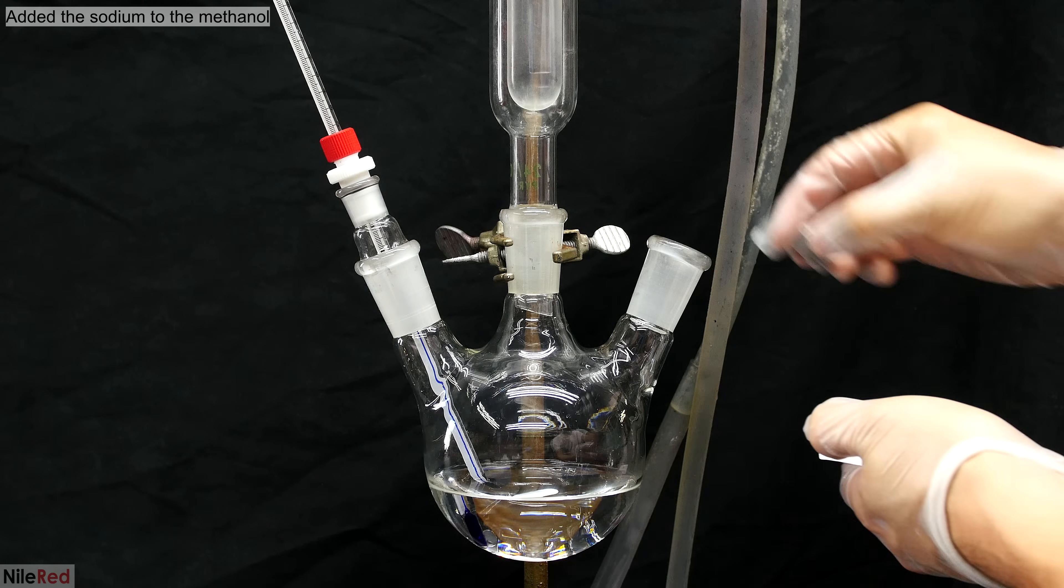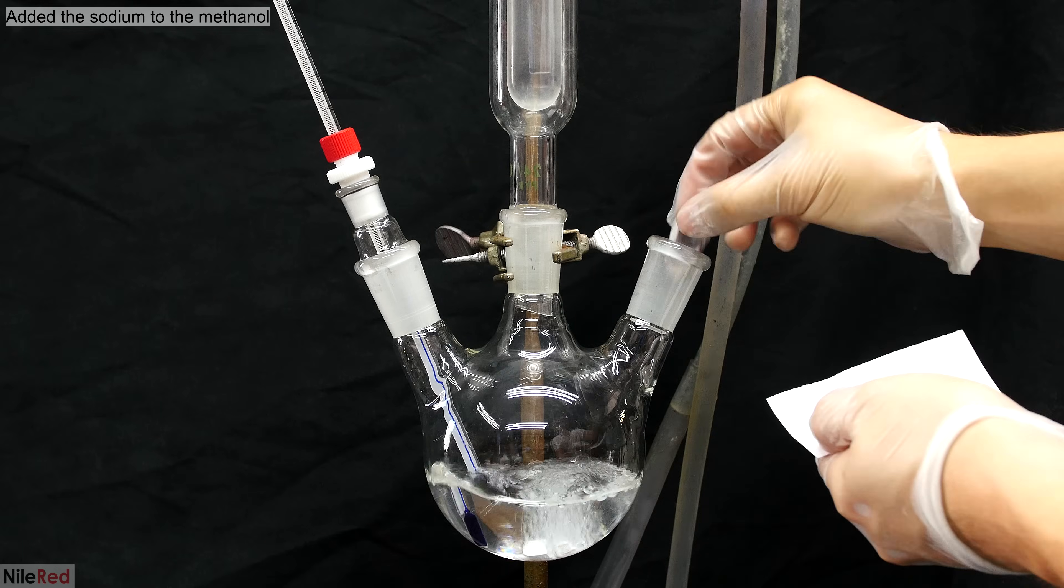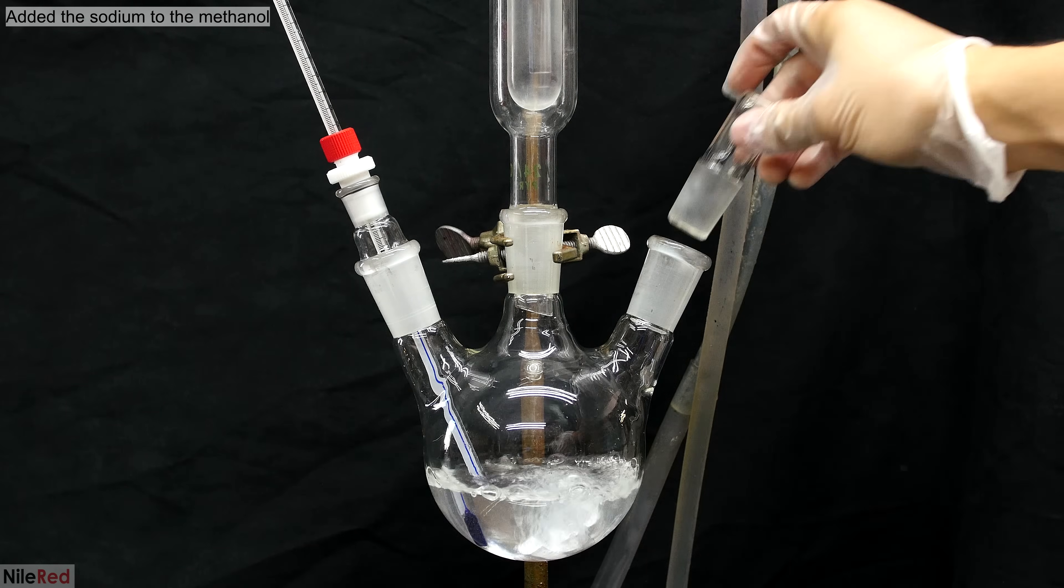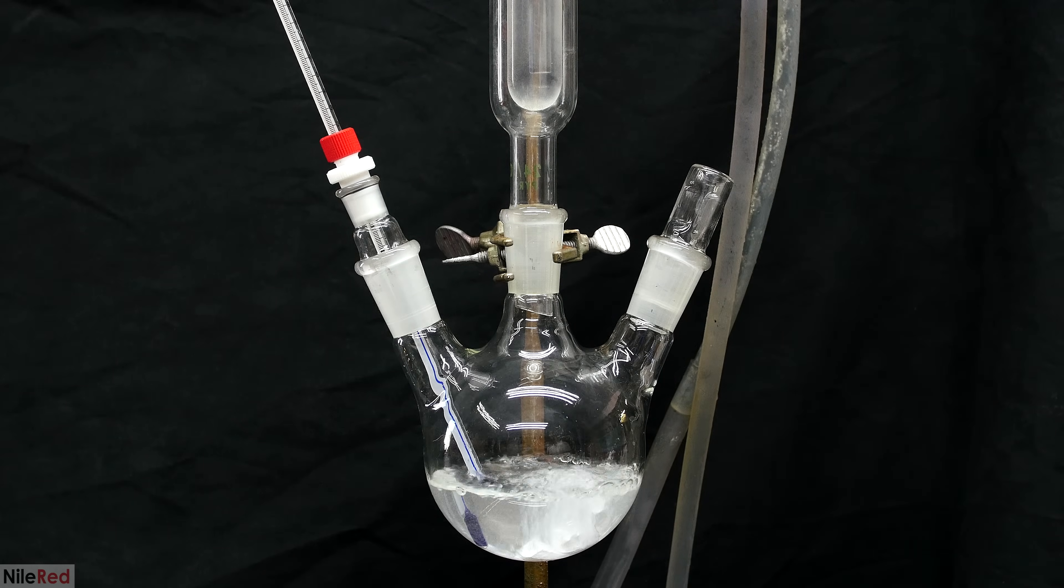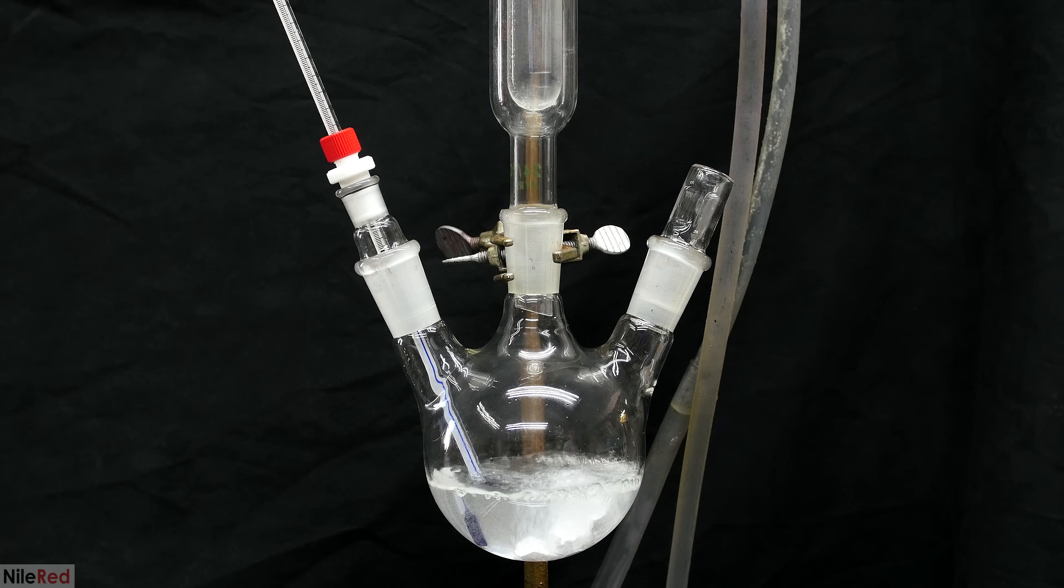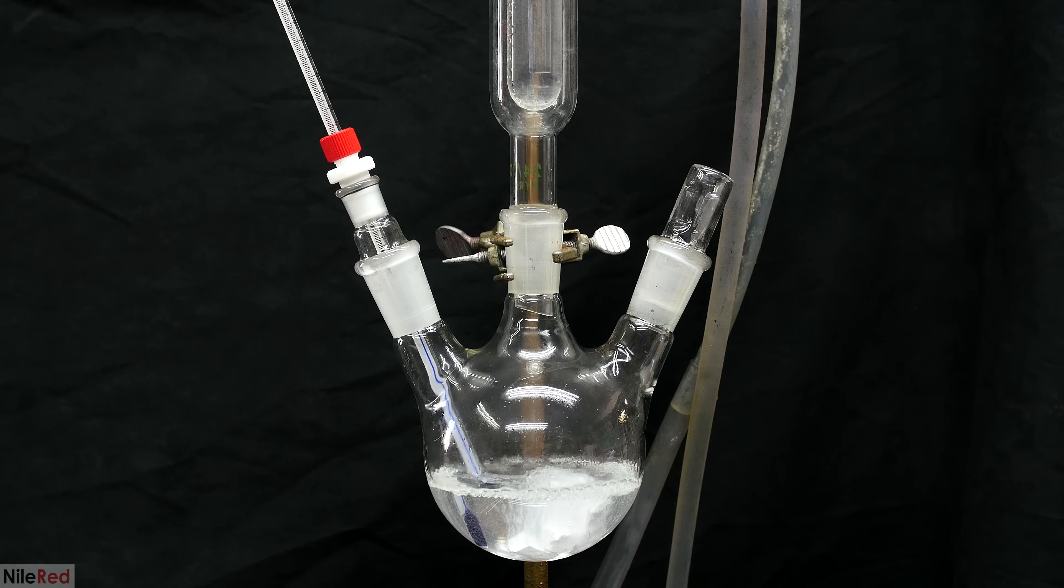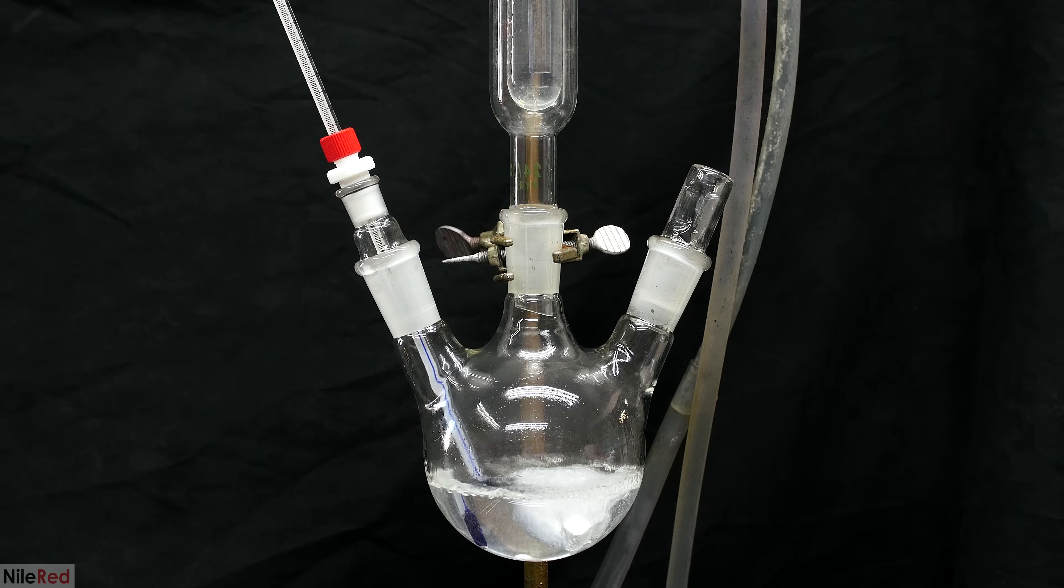Coming back to the round bottom flask with the methanol in it, I go ahead and dump in all of the sodium. You can see that the sodium reacts quite vigorously immediately after being added. The reaction is going to heat the methanol to its boiling point and a lot is going to boil off, so it's very important to have a high efficiency condenser.